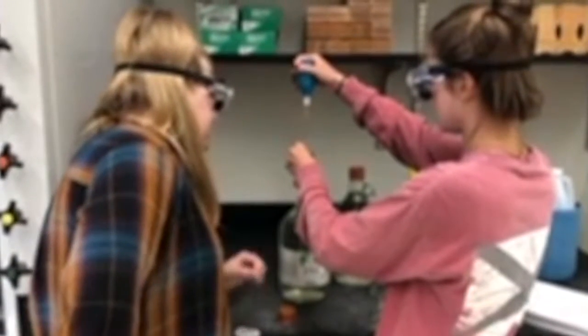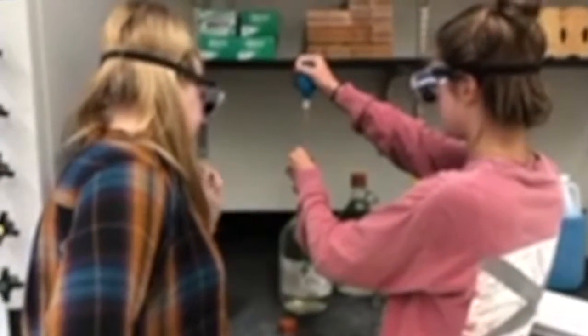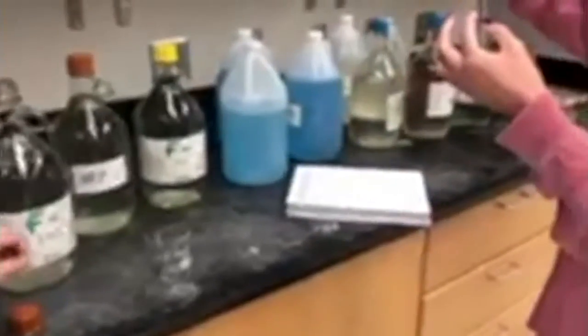Dilution is the process of taking a solvent and adding that to a concentrated solution in order to make it go down in concentration while the amount of solute stays the same. A stock solution is just a pre-mixed, concentrated solution that will be diluted down for actual use in your experiment.